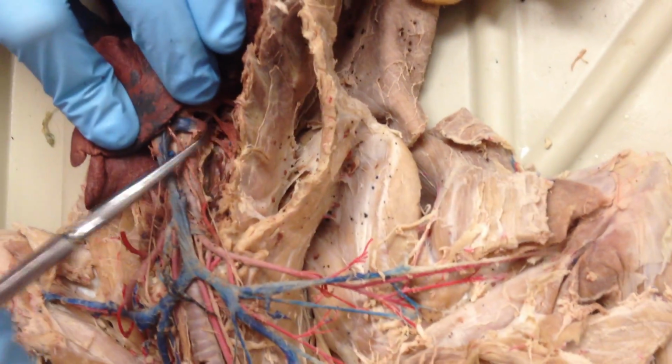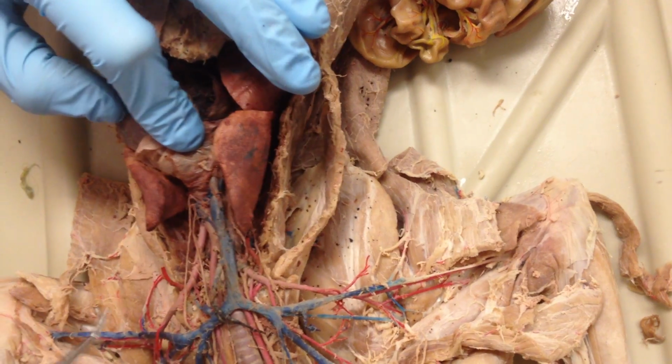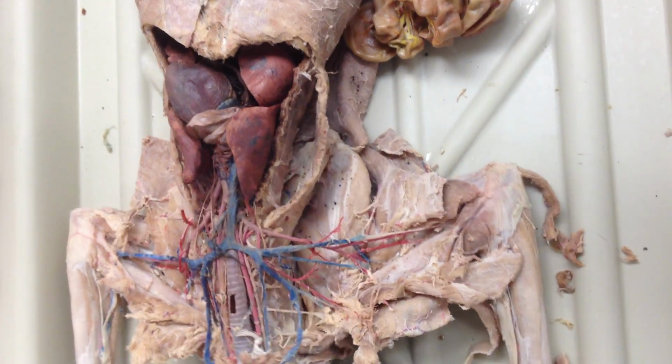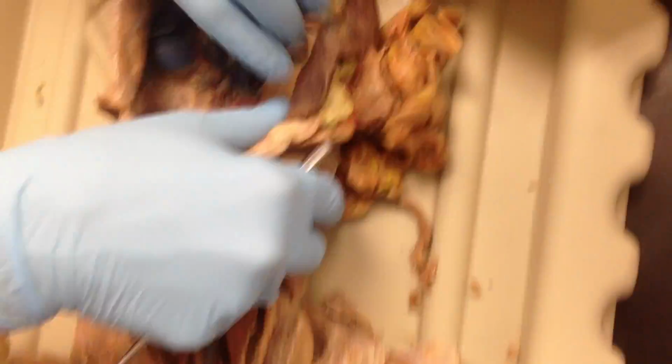vein coming off the heart down here, this big guy, and your pulmonary arteries and veins between your heart and your lungs. Don't forget the colors are flip-flopped in the pulmonary system. Alright, so that's most of the upper body for arteries and veins. So lower body, this is going to be hard to see from over there potentially.